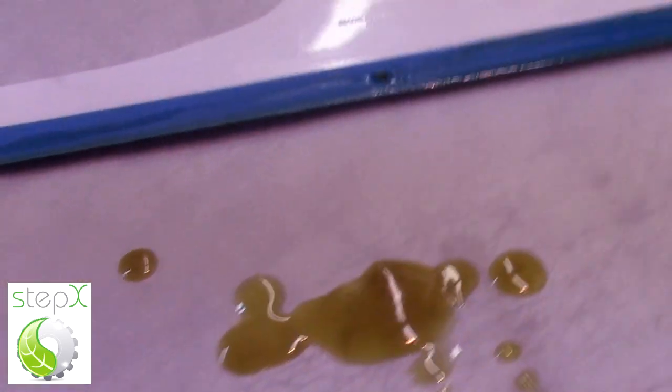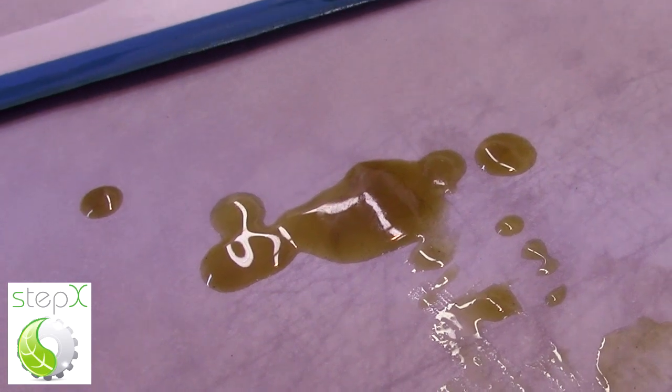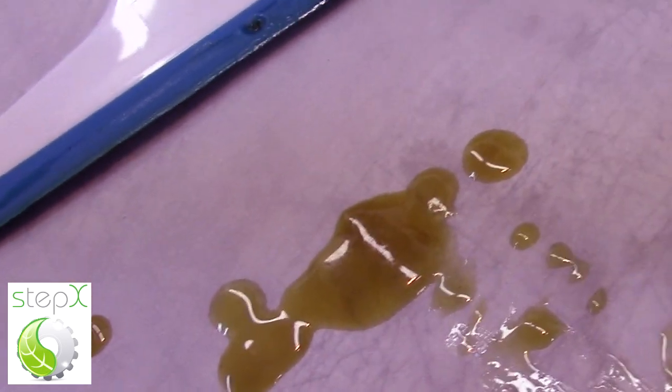You can see that this lavender oil that came directly out had no post-processing, and none is required. It's very clear. There's no particulate matter in it. It's in a liquid state, and it's ready to use.